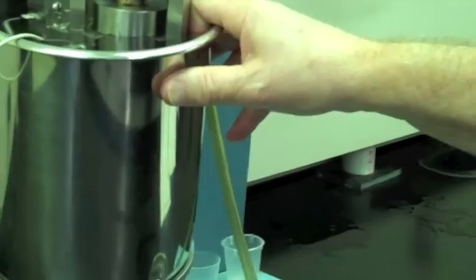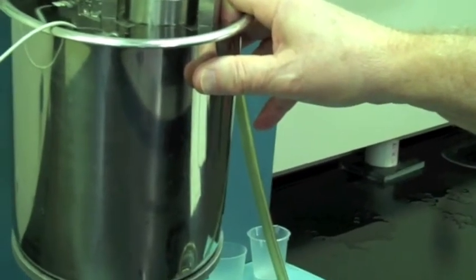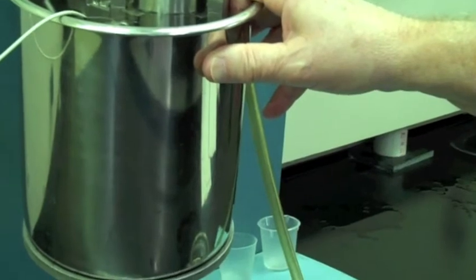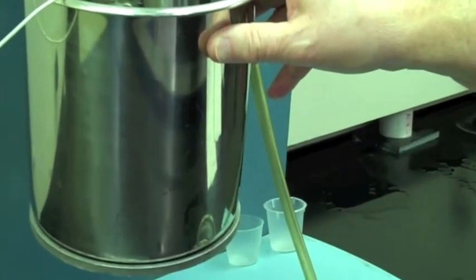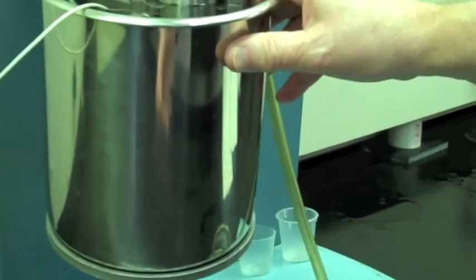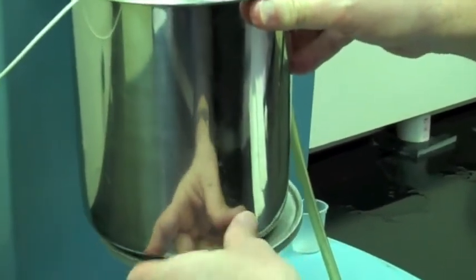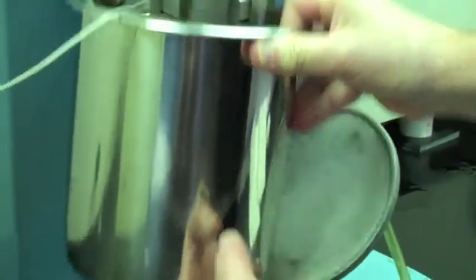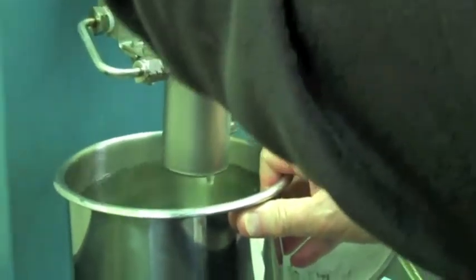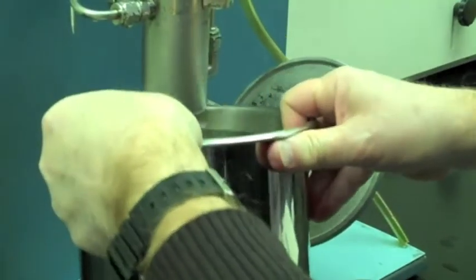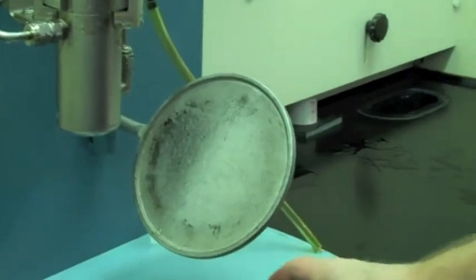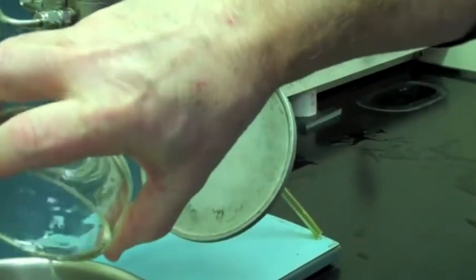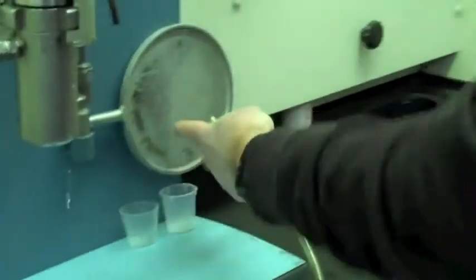And it's drying. The whole point is to eliminate going through the surface tension. That's right. It's not really drying, but it's going from a liquid to a vapor state. Drying to me is getting rid of the water. We hopefully got rid of the water in the alcohols.